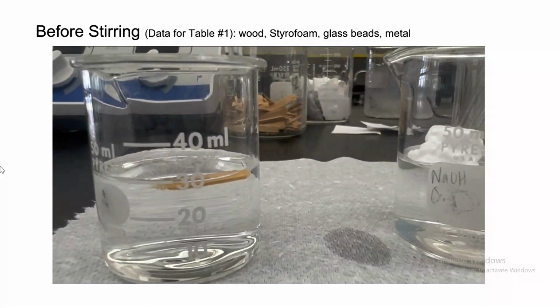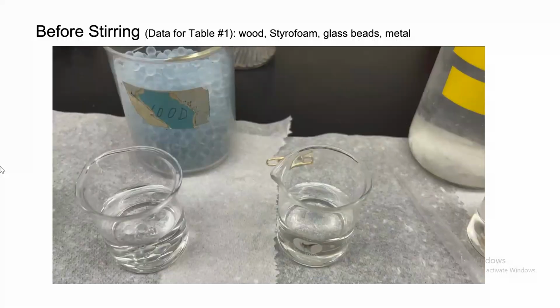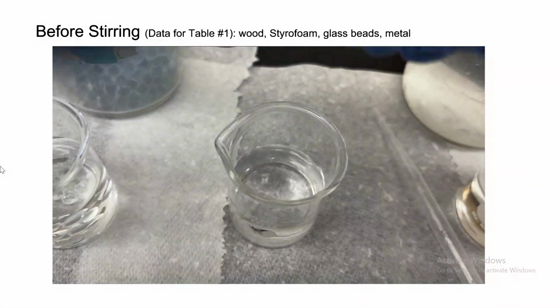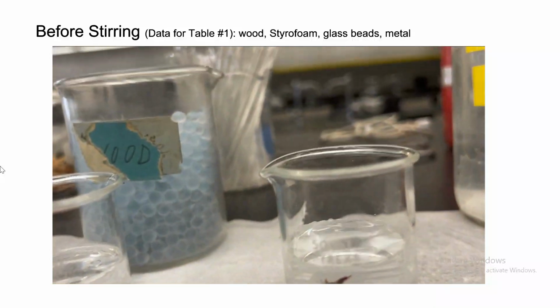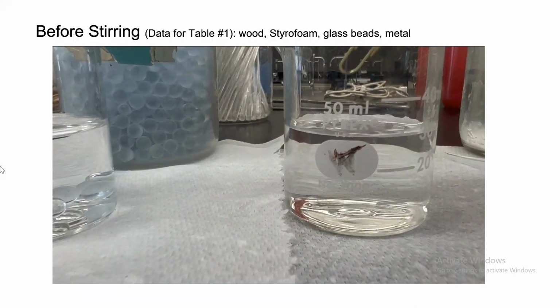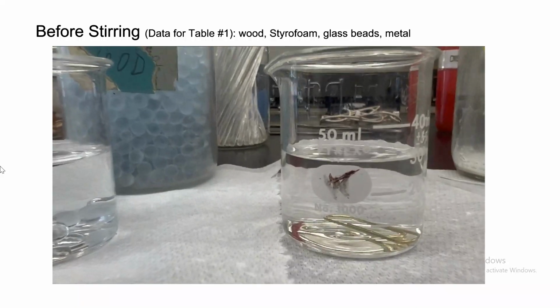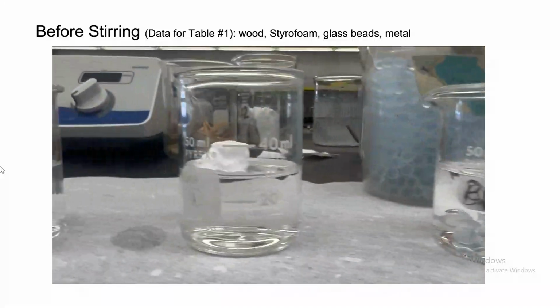All right. And last but not least, we're gonna have the metal. Here is the metal paper clip, a piece of metal. We're gonna drop it in water, and now we're gonna notice where it's gonna go. Is it gonna go to the bottom or is it gonna float? Drop it, yes, so it goes to the bottom. So the metal sinks, and therefore it is more dense.